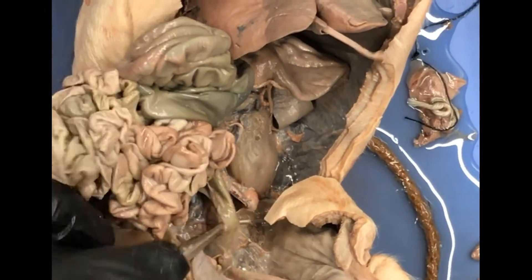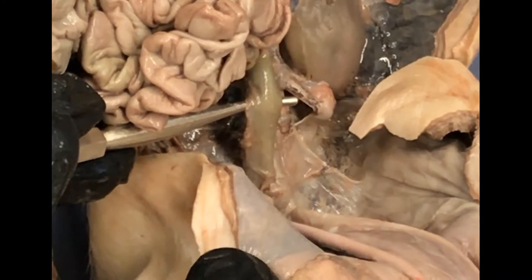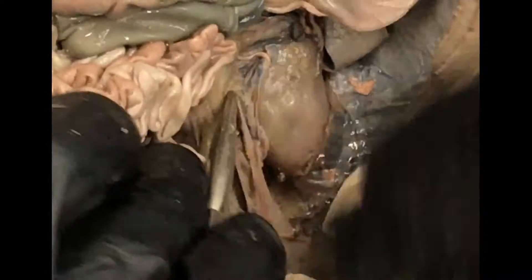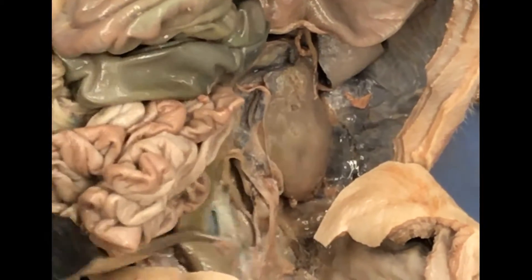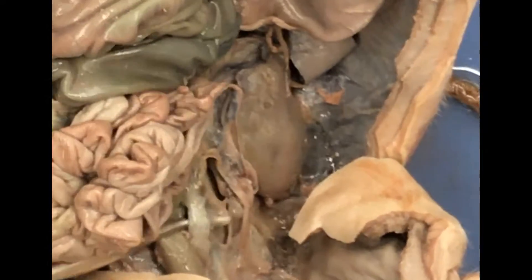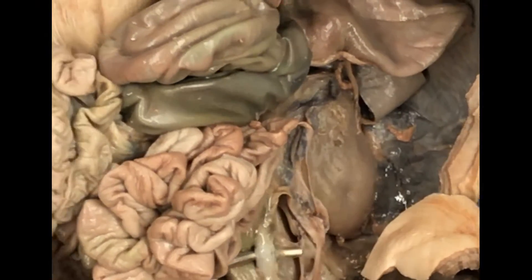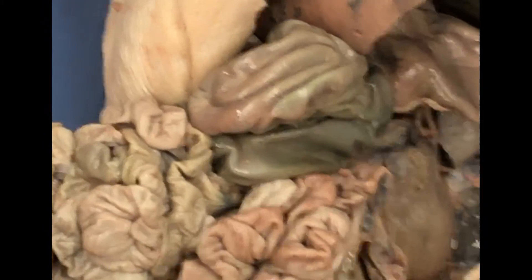Another thing you can see back there, if you pull the intestines aside, is the descending colon leading to the rectum — it's green. And in the vicinity of that, if you peel away a lot of this peritoneum, you should be able to find a pretty thick tube — that's the abdominal aorta. It should be kind of whitish. That looks white — that's the abdominal aorta.